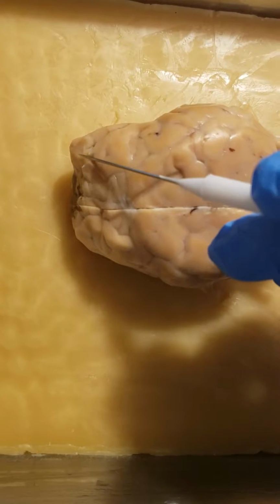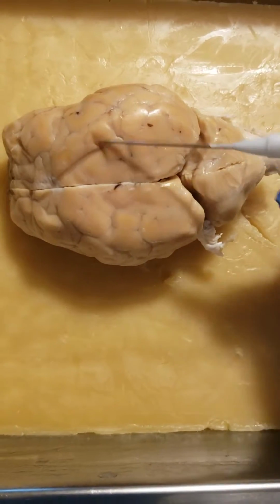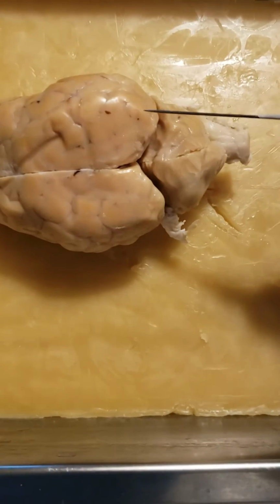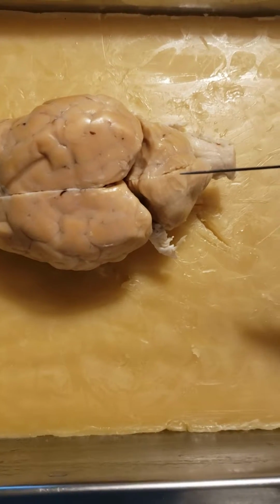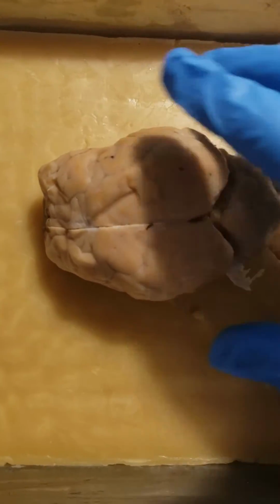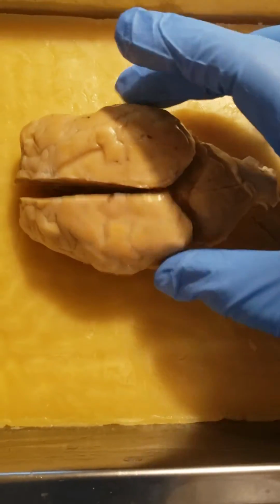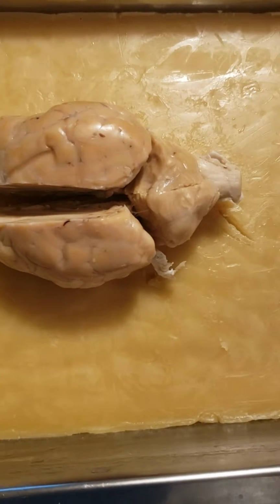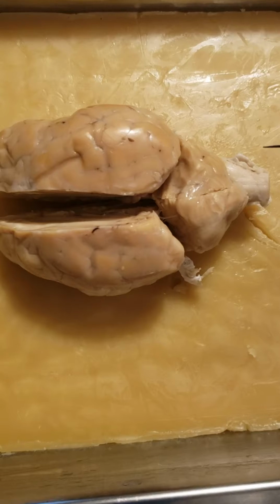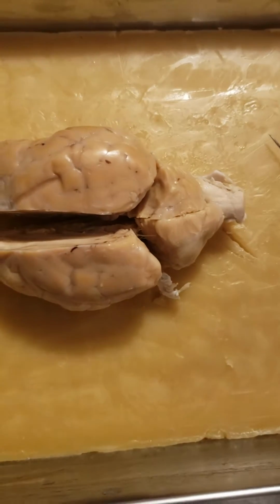Then on a sheep, the frontal lobe is here. It's a small section. And then the parietal lobe is here. It's a larger section. And then the occipital lobe is right here. The temporal lobe, I have to flip to the side, right here. This will be the temporal lobe on each side. This here is the cerebellum.